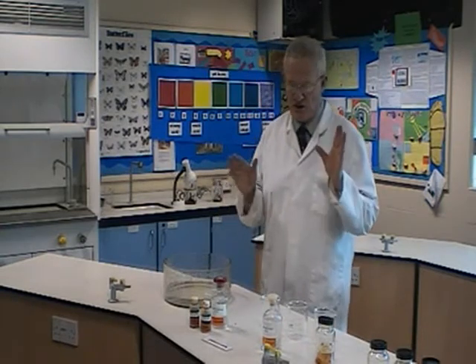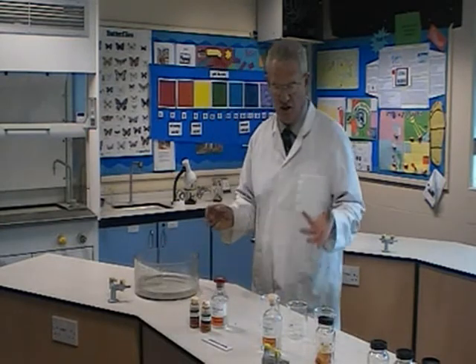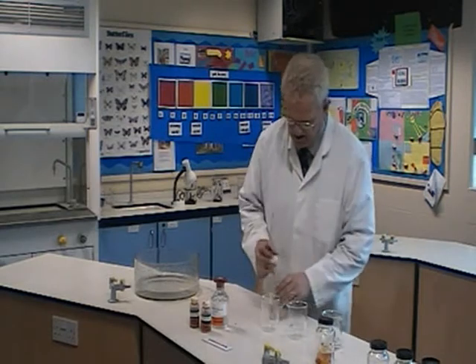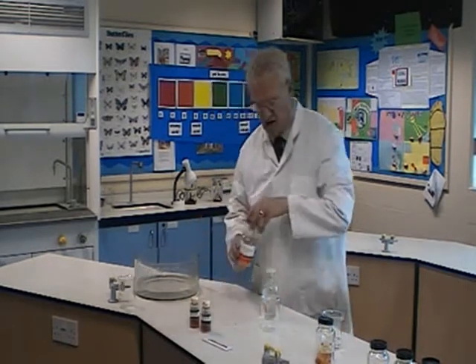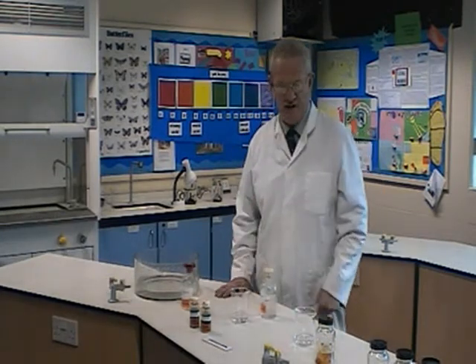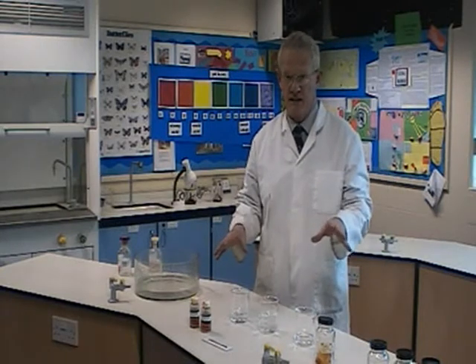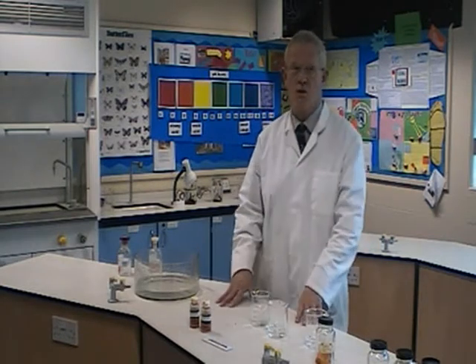With a lot of children this can probably be done as a revision lesson — either in year 8 or year 9, I usually do it in year 9. What I'm going to do to start off with is put some acid into that beaker, some alkali into that beaker, and in the third beaker I will have ordinary tap water. I'll mix them all up and say I don't know which one's which — I want you to find out.